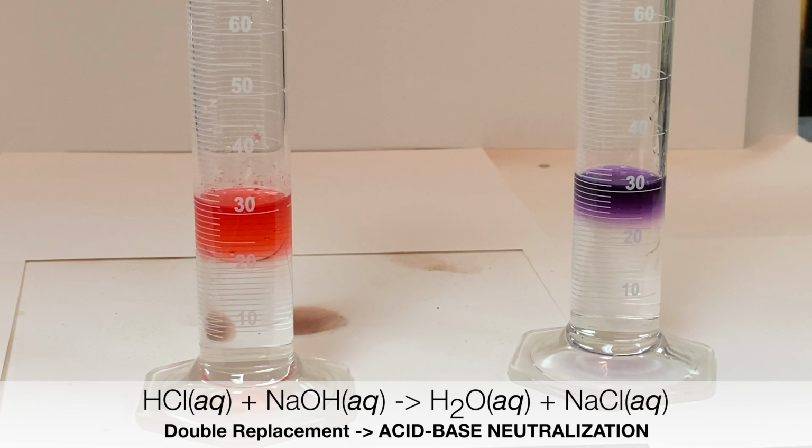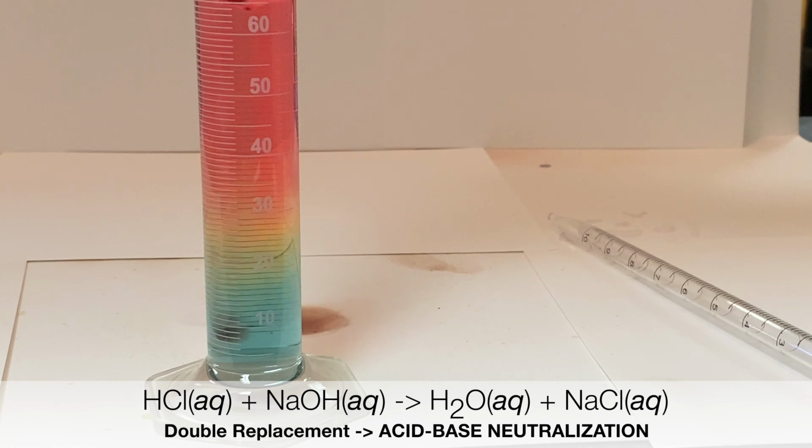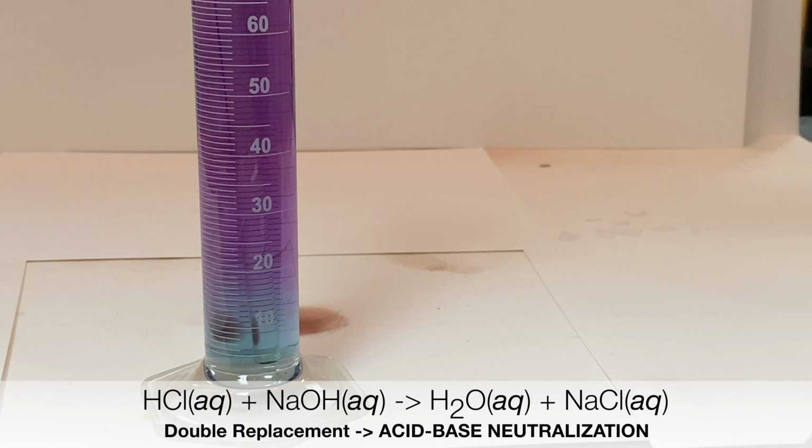The solution will also change different colors depending on the intensity of the acidity or basicity. When the solution is perfectly neutral, which should happen when a stoichiometric proportion of both acid and base are mixed, we should get a perfect green color, which would indicate a pH of 7.